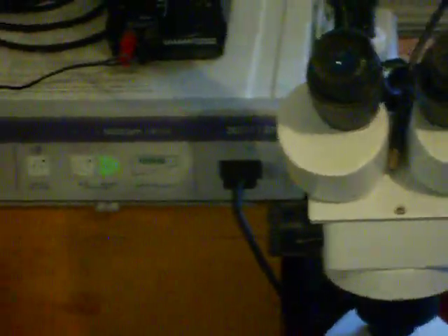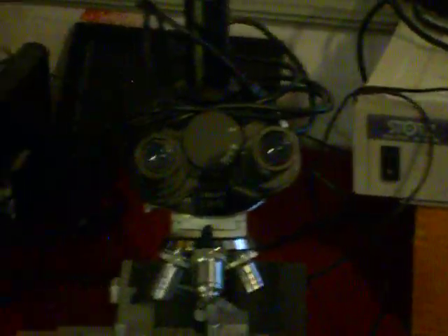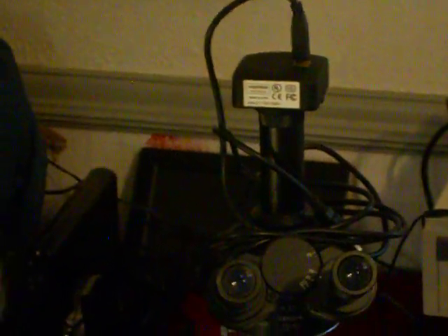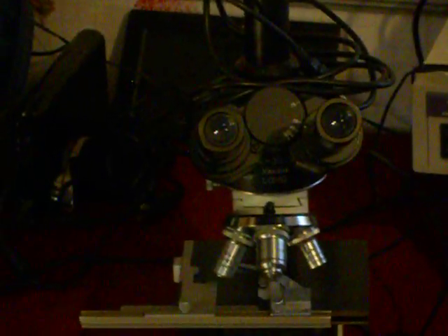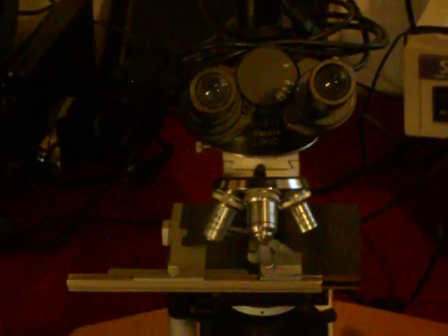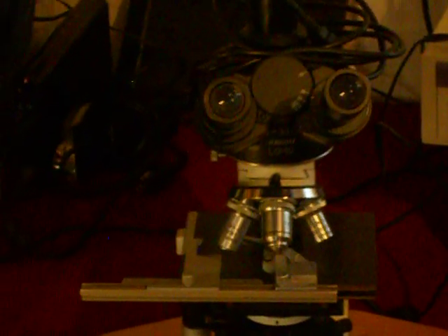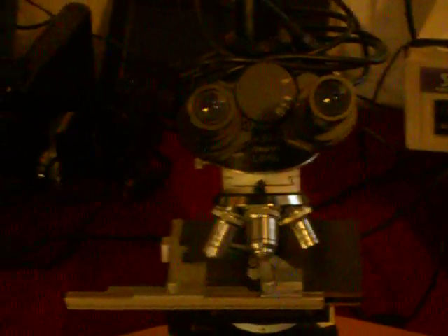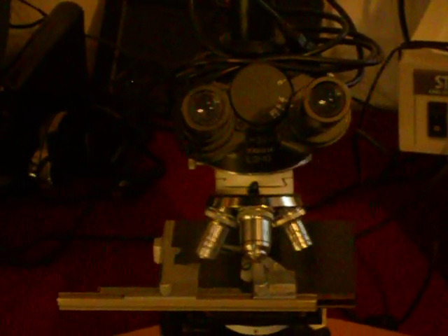Then, once you've done that, you go over to your standard light microscope. This is actually phase contrast, but again, notice it has a camera port behind the oculars, so you can actually use your oculars comfortably. It has 4 magnifications on it. I usually use the least powerful one, the second, and sometimes the third.